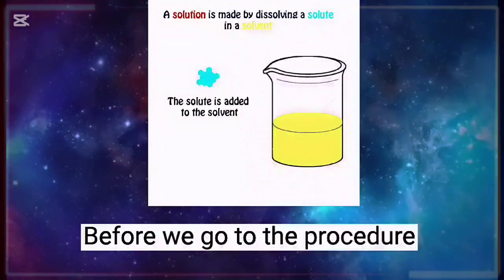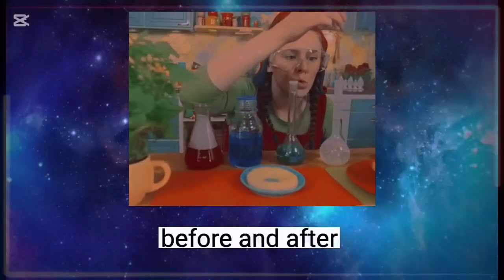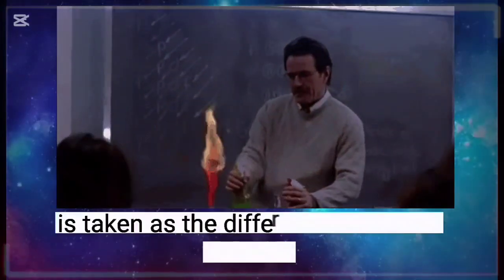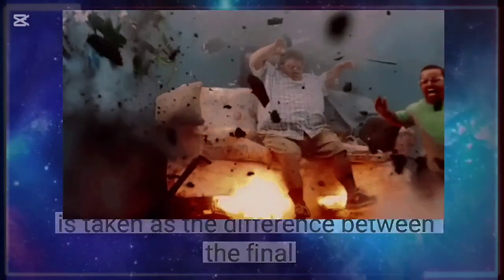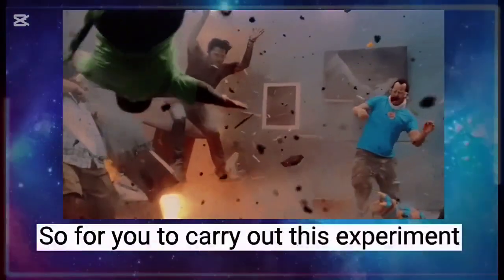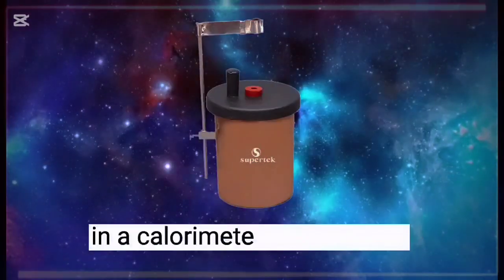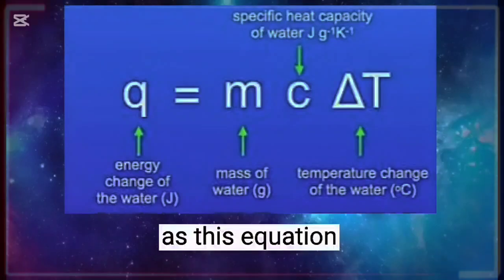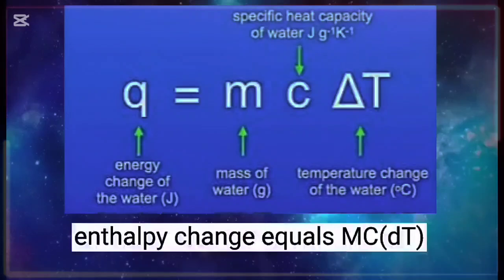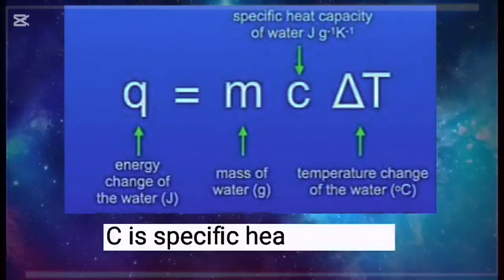So before we go to the procedure, you have to also know that the temperature change before and after the dissolution of the sodium thiosulphate is taken as the difference between the final and initial temperature, which we regard as change in T. For you to carry out this experiment, you have to also know that the heat transferred in a calorimeter is expressed as this equation. You can see Q, which is also enthalpy change, equals mc change in temperature. If you have the mass, c is specific heat capacity.